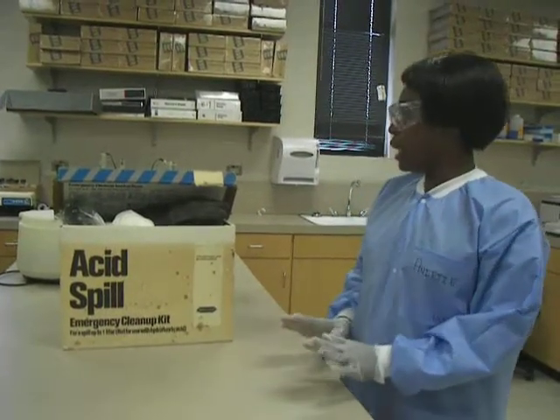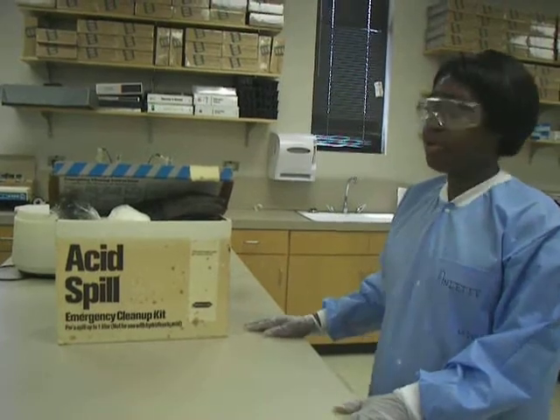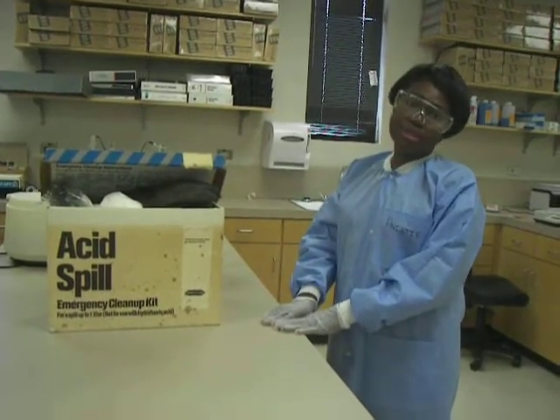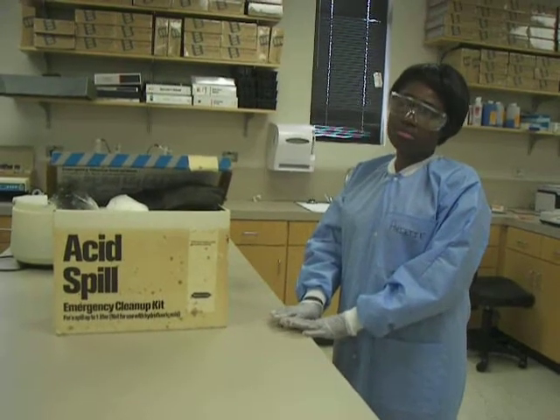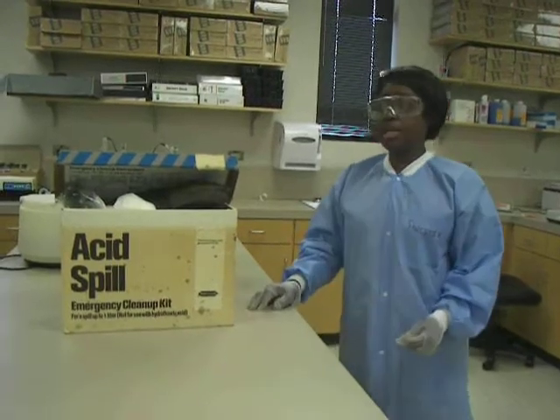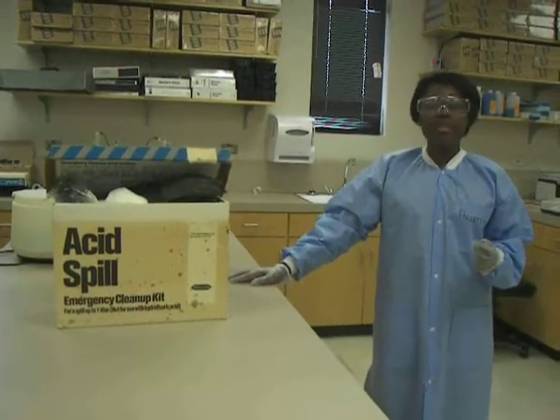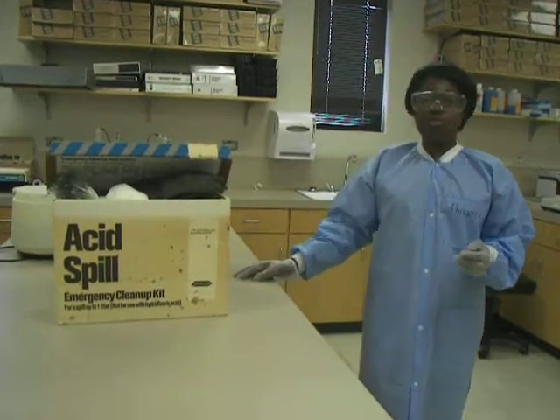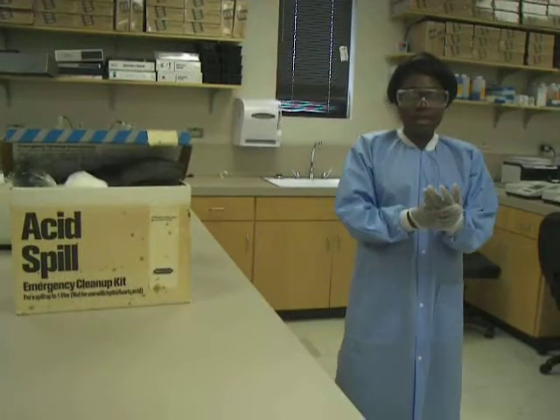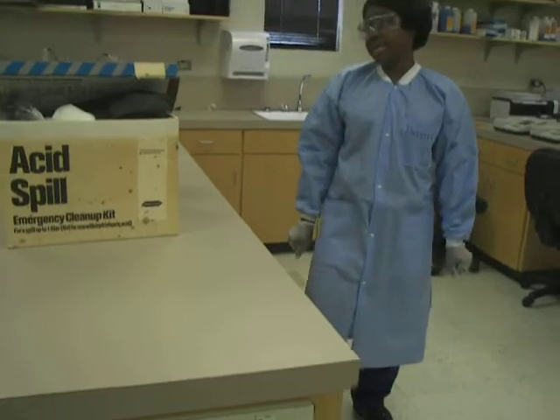Now, before you start any work in the laboratory, it is really important that you have some of these things in mind. There are certain rules that we need to follow. First of all, make sure you have the right attire — a lab coat with long sleeves, your gloves, safety goggles, and closed-toe shoes in case of any chemical spill.